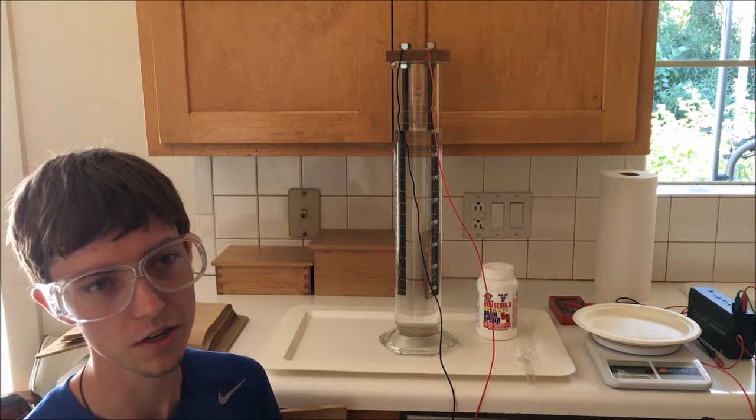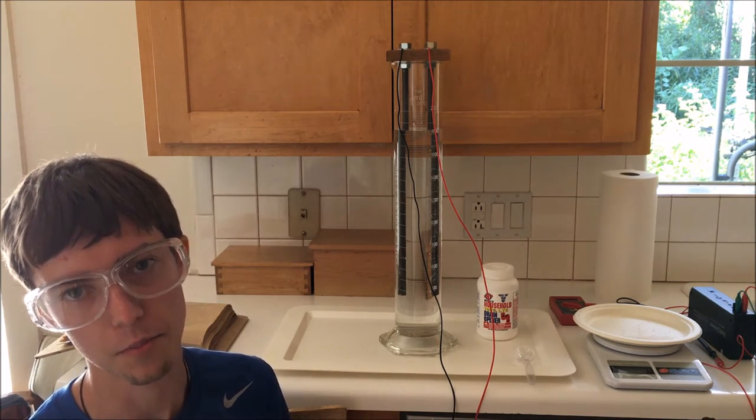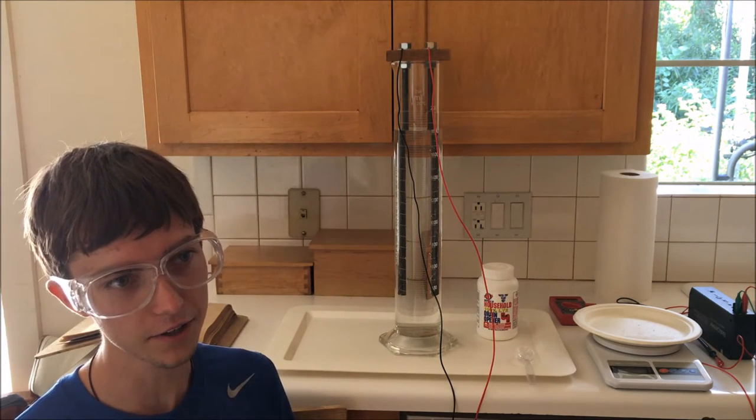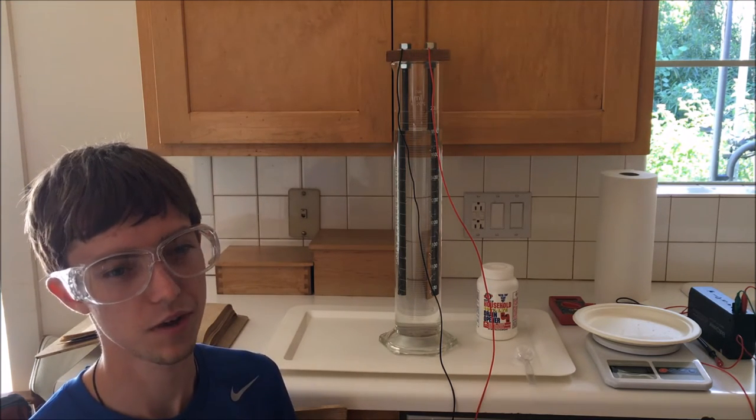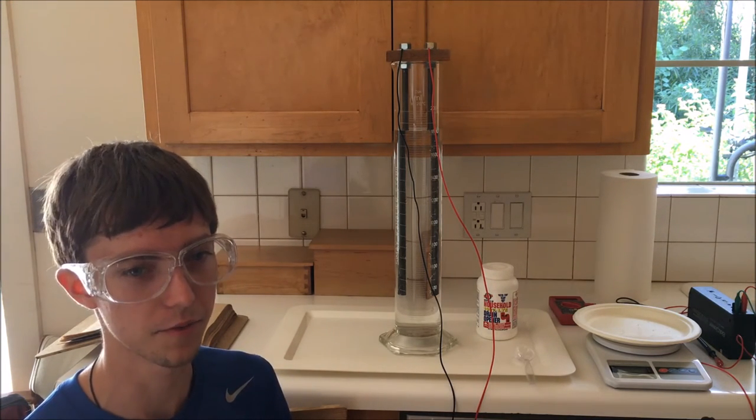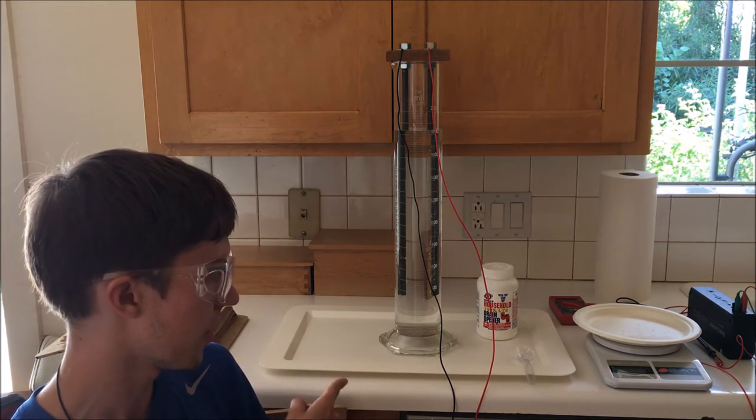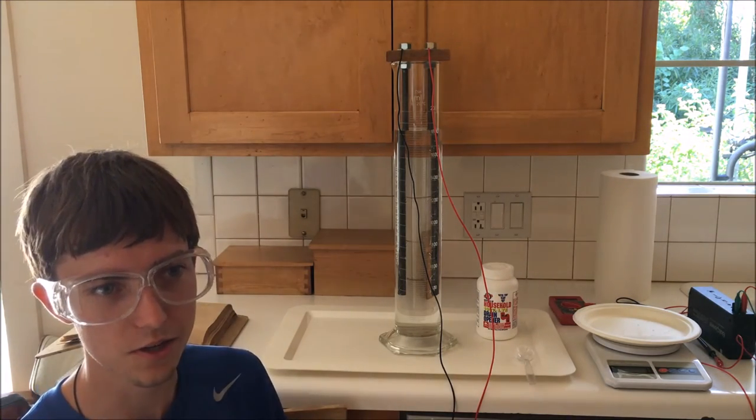I'll probably be producing a few more videos in the future about the progress of my enrichment reaction, and eventually, hopefully, I'll be able to show that I have some heavy water manufactured from this process. So, let me cut to adding all this lye to the solution, and I'll see you in a minute.